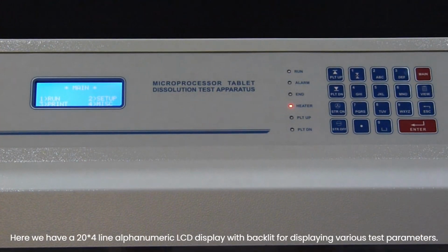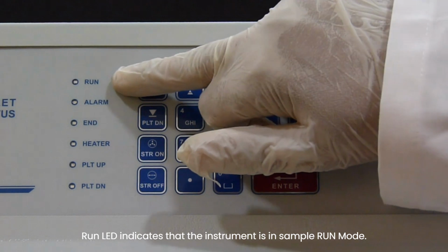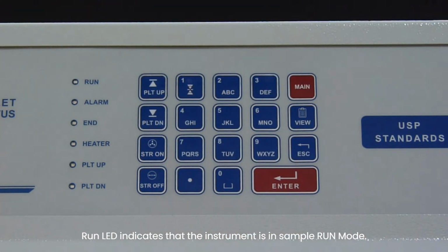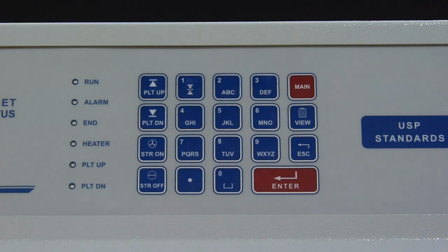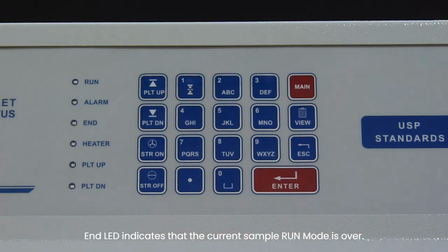Here we have a 20 into 4-line alphanumeric LCD display with backlit for displaying various test parameters. Run LED indicates that the instrument is in sample run mode. Alarm LED indicates that an alarm is reached for test over interruption. End LED indicates that the current sample run mode is over.